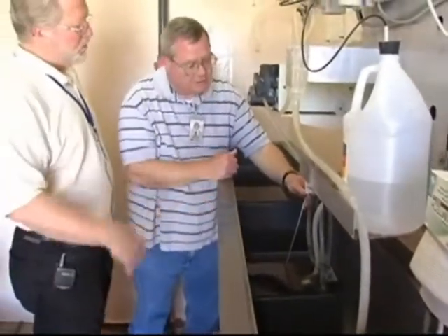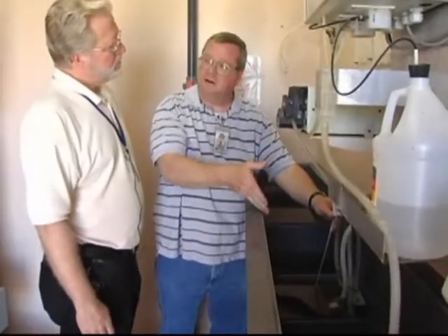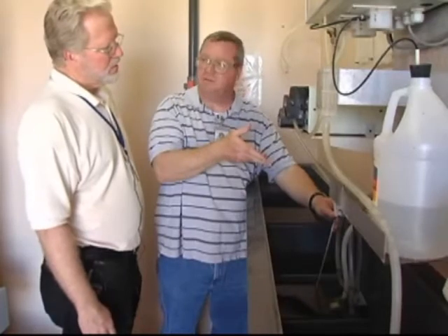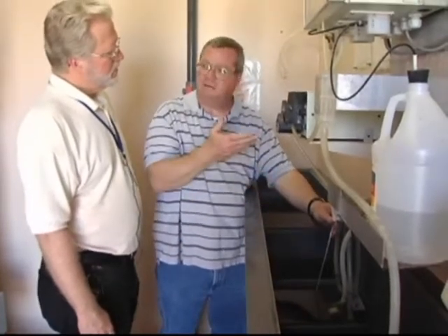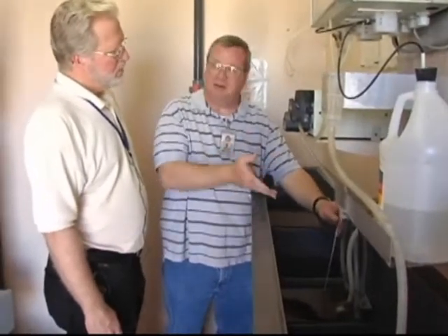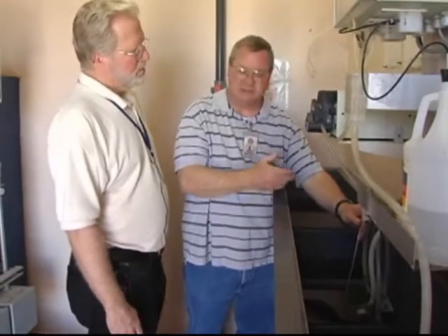And so you also do duplicates once a week here? Yeah, we'll do a duplicate here. Using this thermometer, what you do is pull it out and write the temperature down. And using the correction factor, we'll pull the thermometer out and let it change so we can see, when we place it back in the water, whether it rises or falls — and we can see it change.